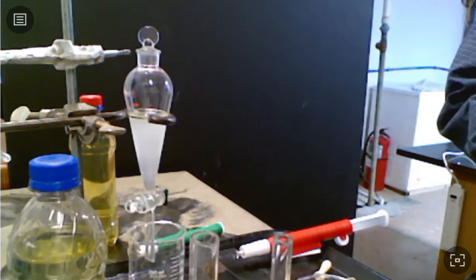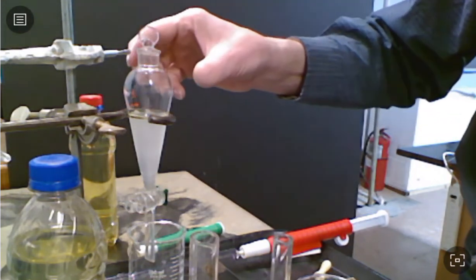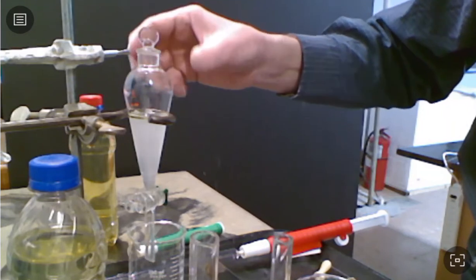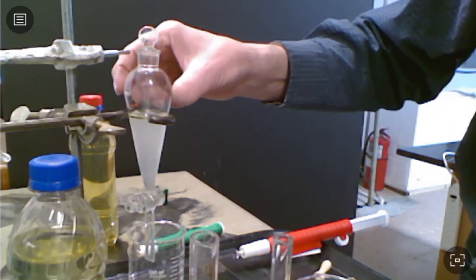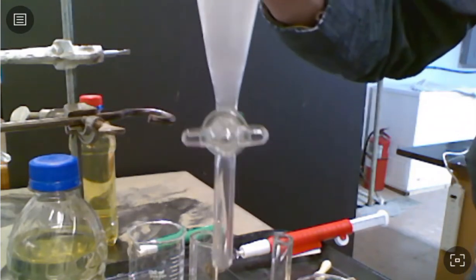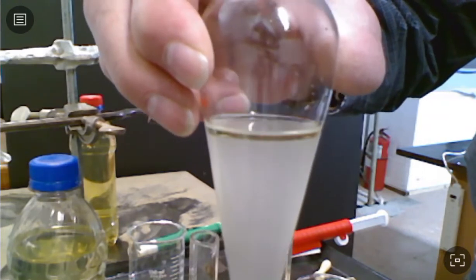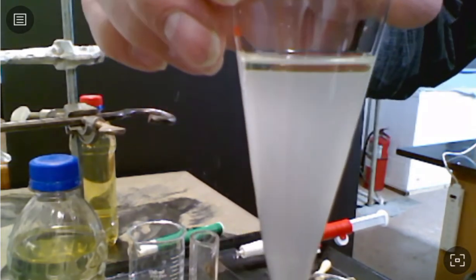All right, well, it's been about 15 minutes to let set, and unfortunately, the cloudiness hasn't cleared up a whole lot. I don't think that's going to change our result a great deal. But I can show you that if you look in the gasoline layer, it's just crystal clear, just gasoline up there.